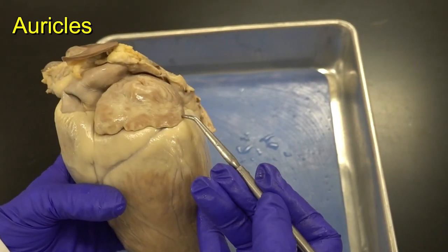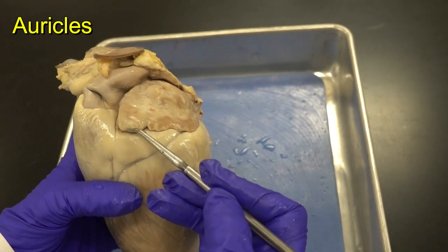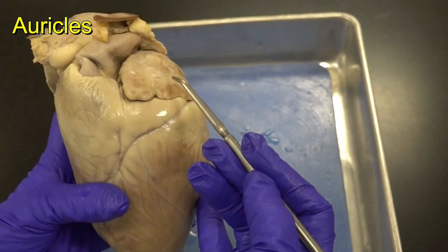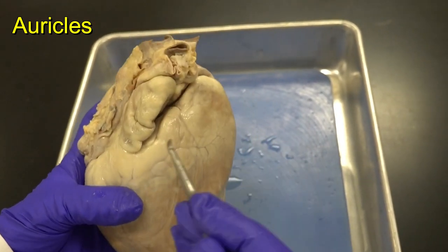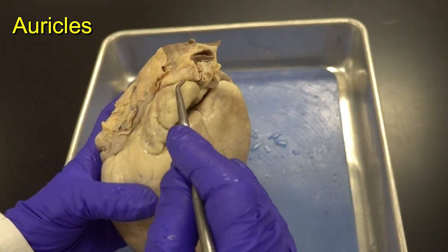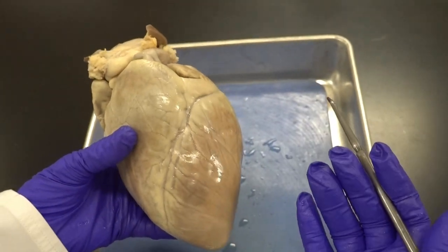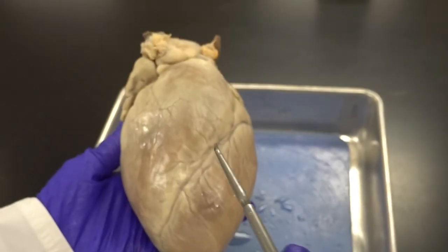Before dissecting, pay attention to the auricles — these pouches or tiny sacs visible on the anterior of both atria. I can see the auricle of the left atrium and also the auricle of the right atrium. Think of them as extra spaces in the atria. This concludes the external anatomy of the heart.